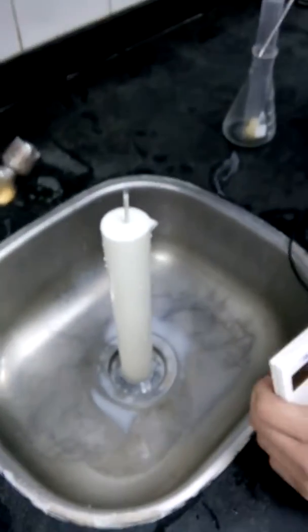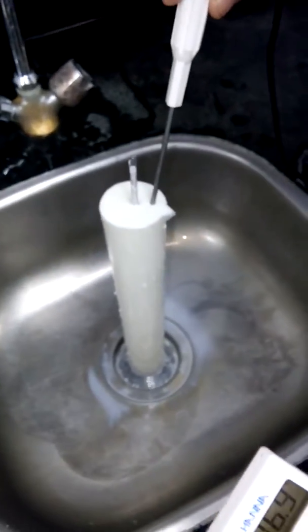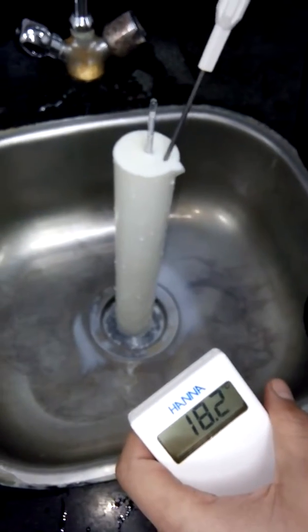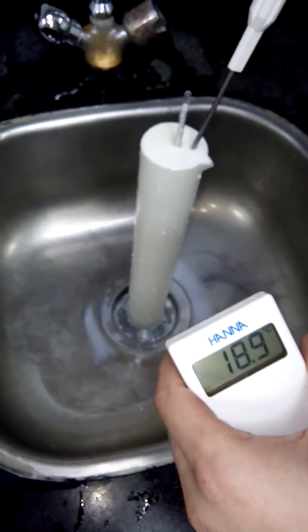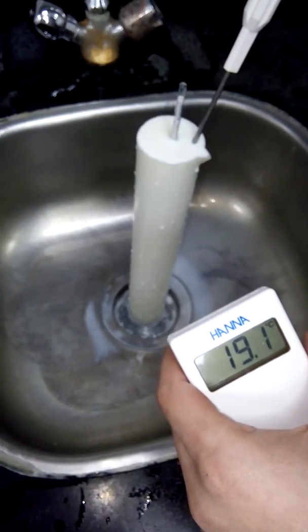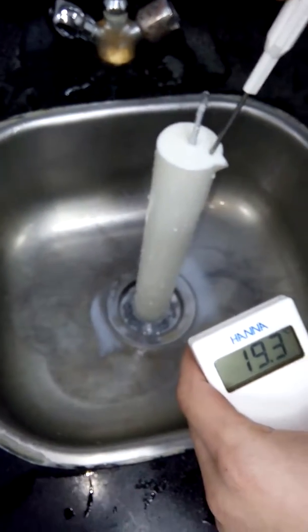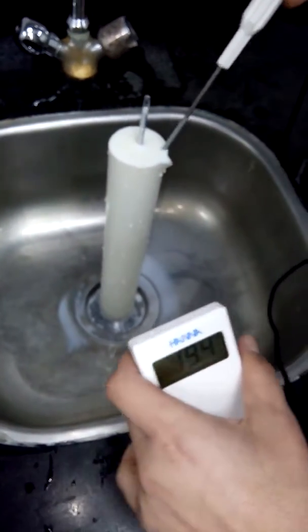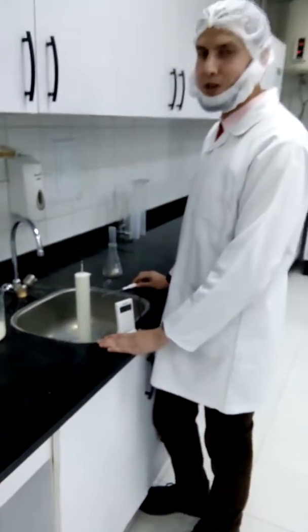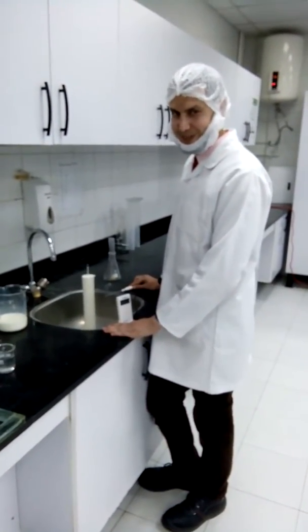Rounding 31.5 gives 32. Since the temperature is almost close to 20°C, no correction is needed, so the final density reading will be 1.032. Thank you.